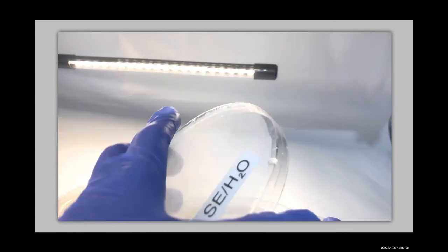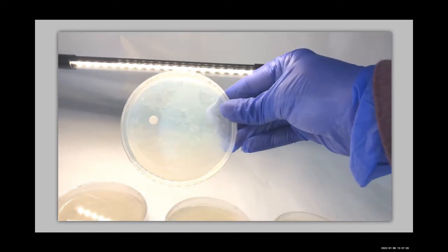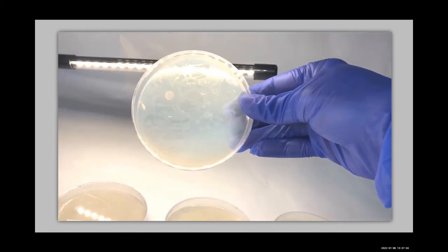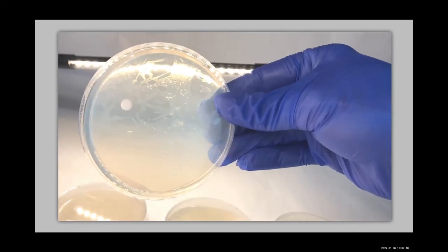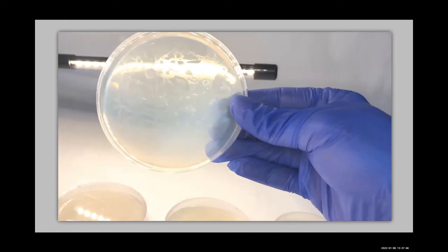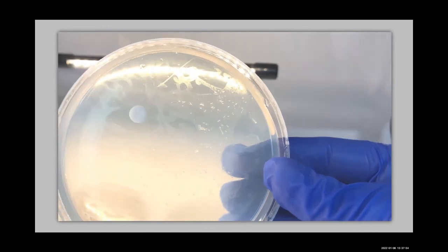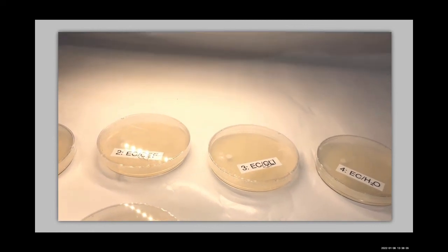And then lastly, let's have a look at our staph with our distilled water. So this one was a little tricky, but there isn't a clearing. You can actually see some of the lines pretty much run through it, or darn close to through it. It looks like this disc was actually still a little bit wet and it just diluted some of the sample. If I can get it close enough to the camera, you can see the lines go through it. There's not really a clearing there. So I'm gonna get some measurements for you.